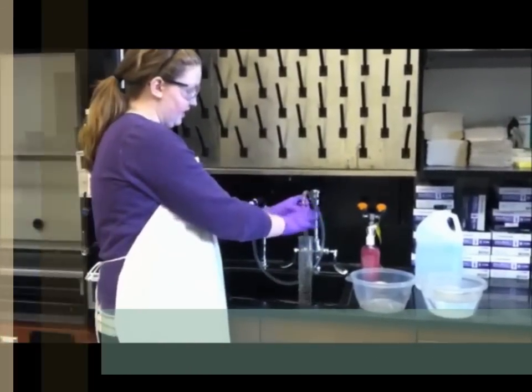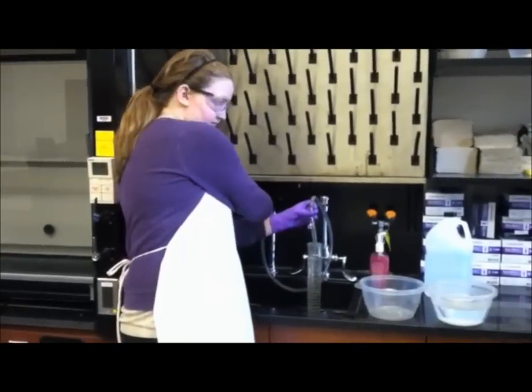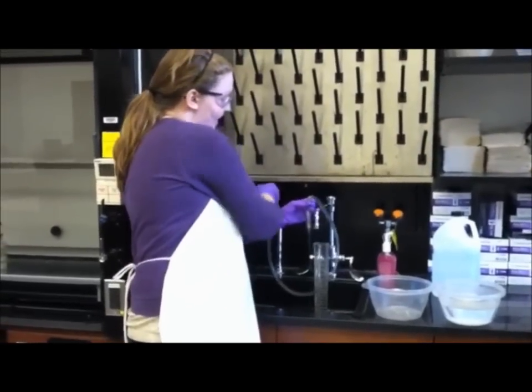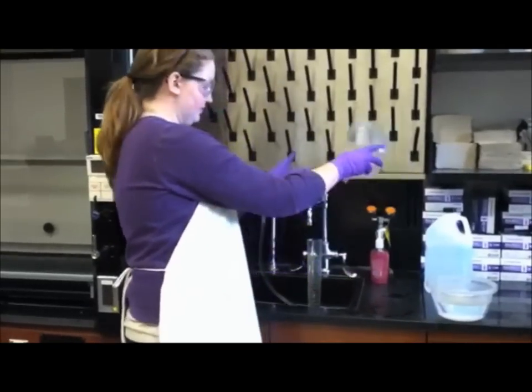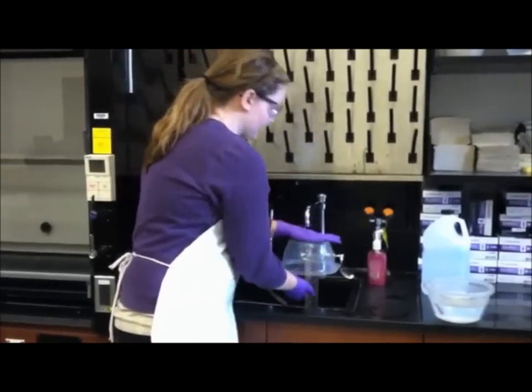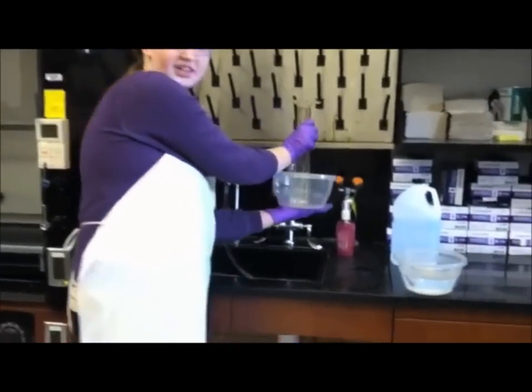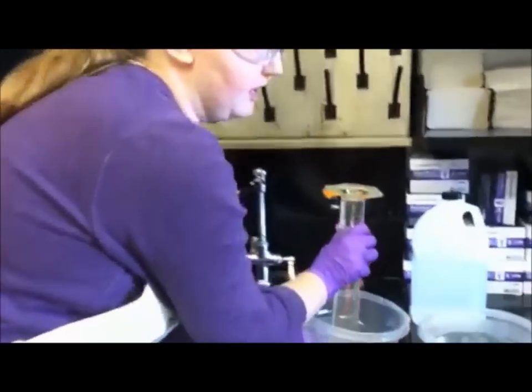I'll show you the first way. Fill up your graduated cylinder, and then you take your bowl and put it on top. Make sure that it's secure, and then flip it over very carefully. If you get a small air bubble, it's negligible, it's fine.